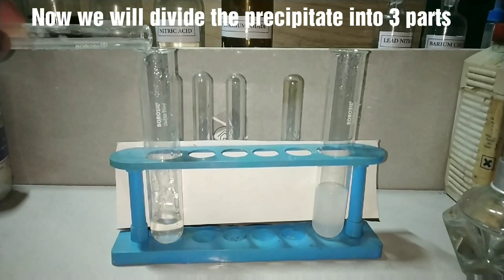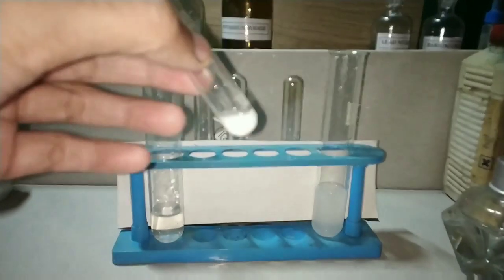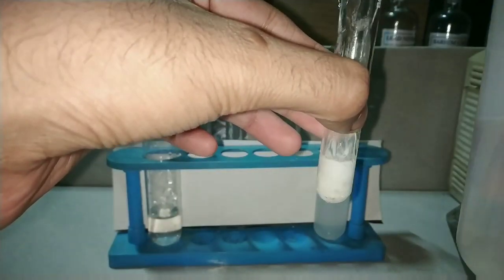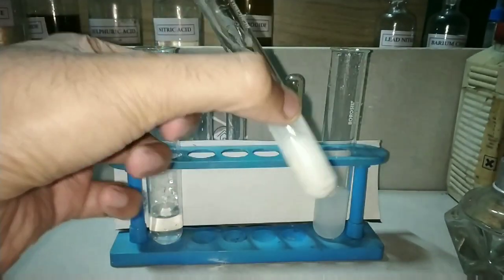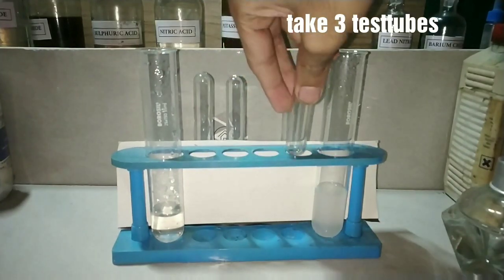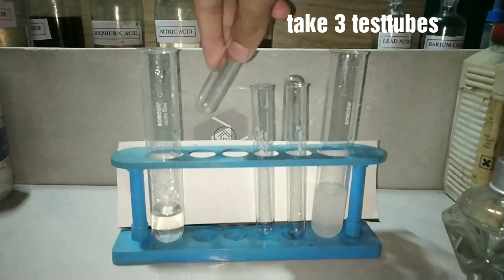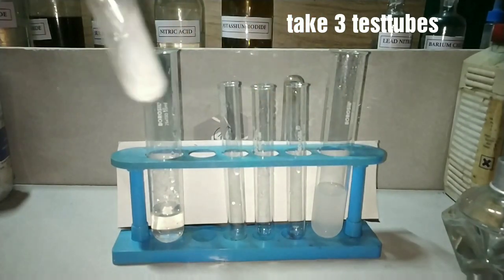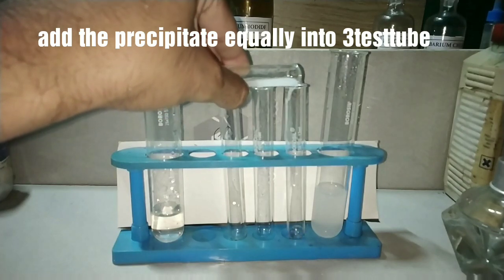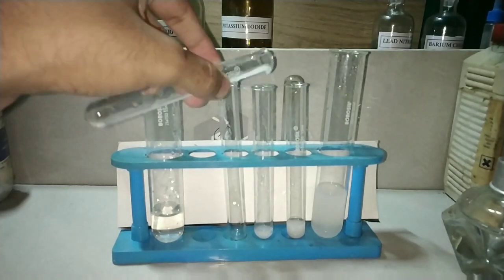Before dividing the precipitate, we will first discard the liquid layer formed above the precipitate in the test tube. We will add a little bit of distilled water to increase the quantity so that we can divide it into three test tubes. We take three clean and dry test tubes and divide the precipitate equally. These three test tubes will be used for three specific confirmatory tests for lead ions.